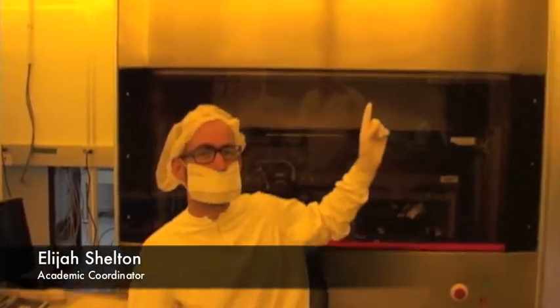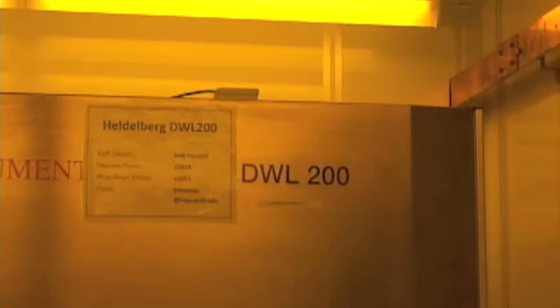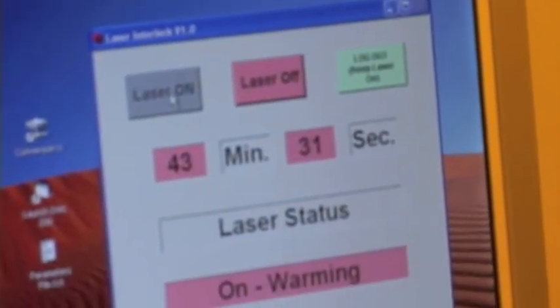Heidelberg DWL200 mask writer. And we just turned on the laser, as you can see right here. So it's gonna warm up for about 45 minutes and then we can start writing our mask.